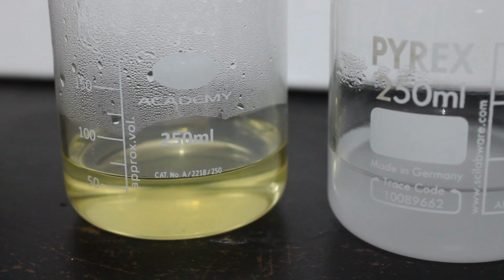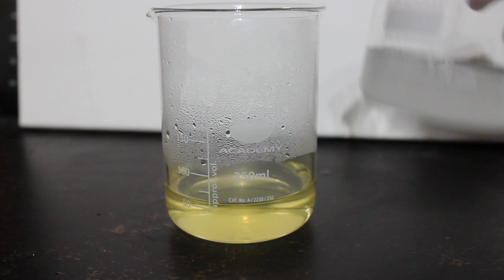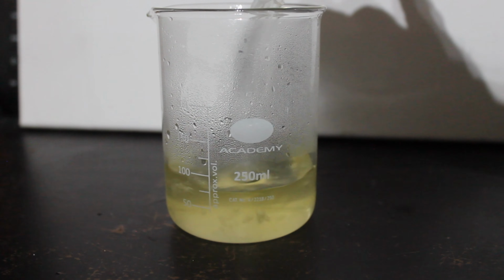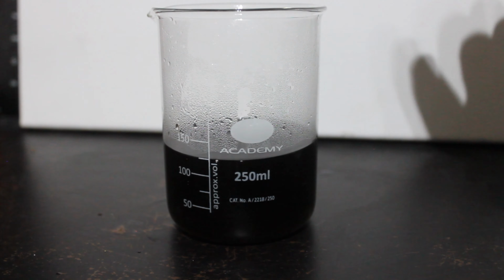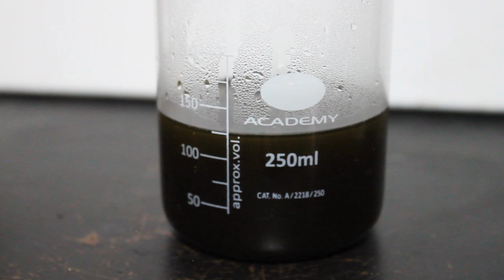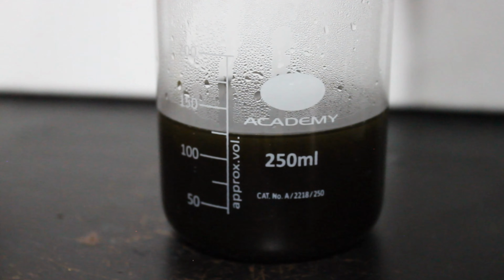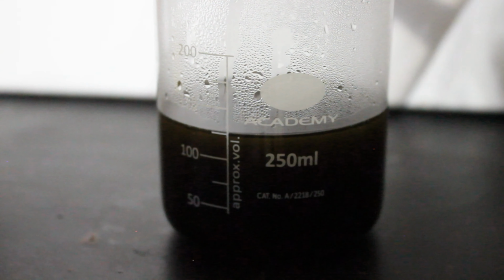It's now time for us to combine solutions B and C. As we do so, the solution changes to a dark blue in less than 1 second as iodine is reacting with the starch. A very quick chemical clock. But what is novel about this clock reaction is that it's an example of a reversible iodine clock.